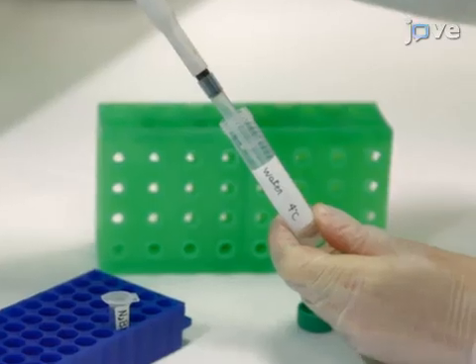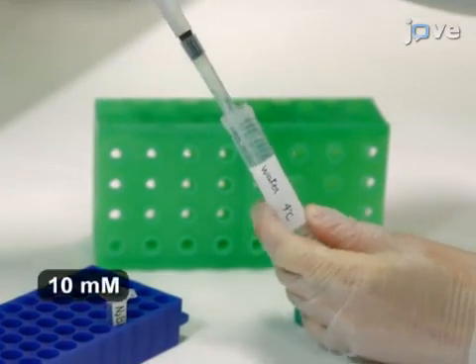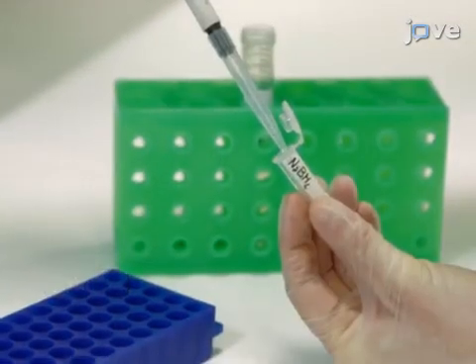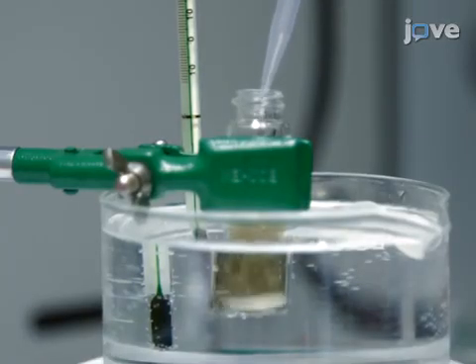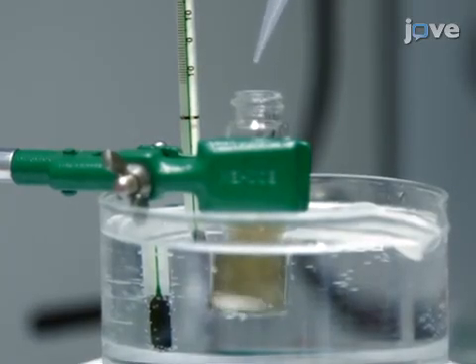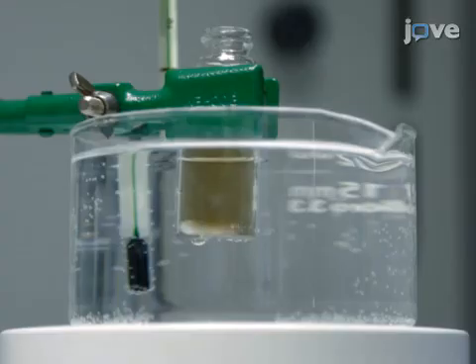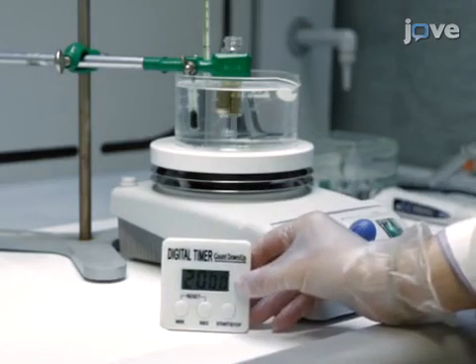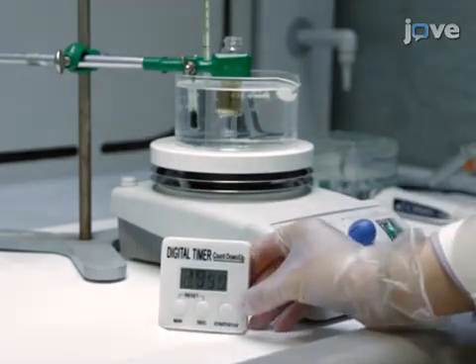Subsequently, make 600 microliters of a sodium borohydride solution in water at 4 degrees Celsius and add this to the rapidly stirred CTAB mixture at 27 degrees Celsius. Check that the color immediately changes from yellow to brownish. Stir the resulting suspension for an additional 20 minutes.